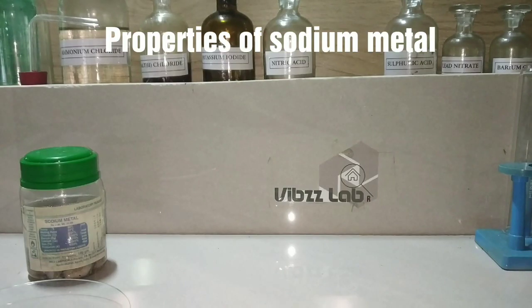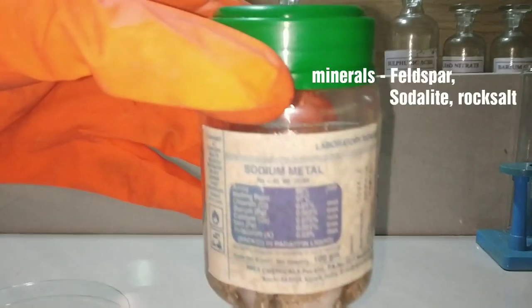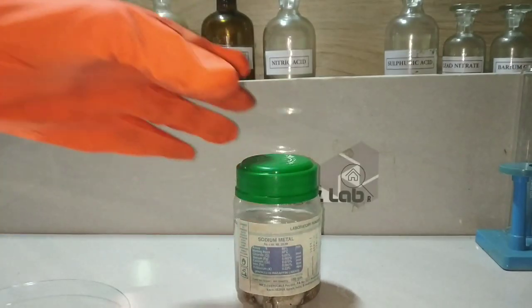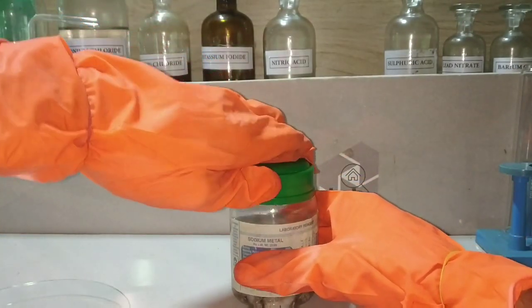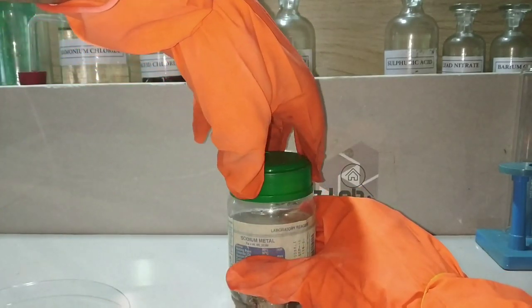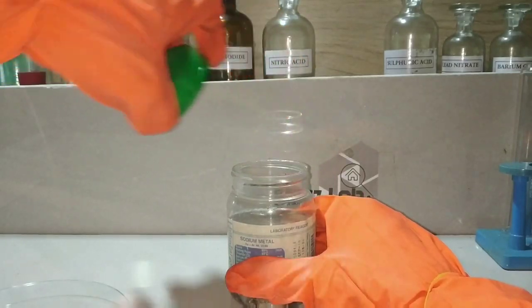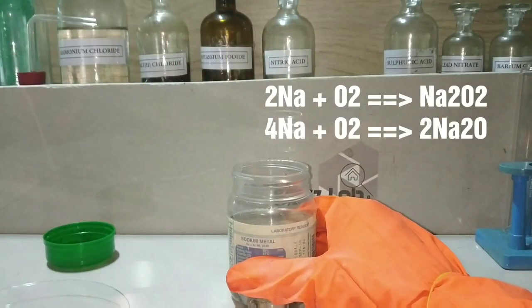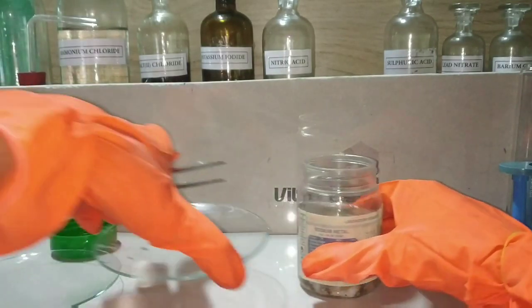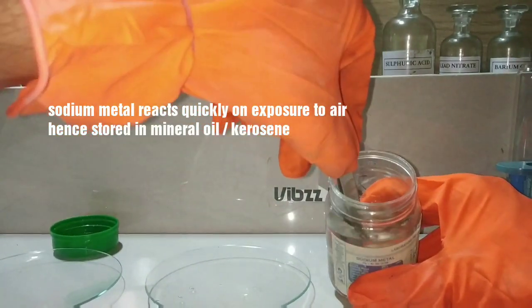Sodium metal can never be found in free state in nature. It is always found in minerals like feldspar, sodalite, or rock salt, that is sodium chloride. Since sodium metal has a single electron in its outermost shell, it is highly reactive, and on exposure to air it will react with the oxygen and moisture present in it, forming the oxides of sodium and sodium hydroxide. Hence, it is always stored in mineral oil or kerosene, as you can see.